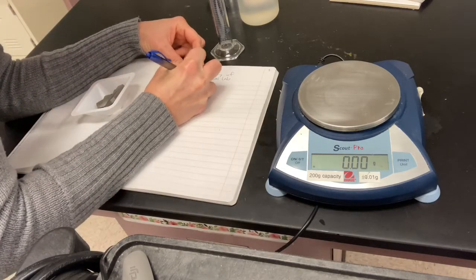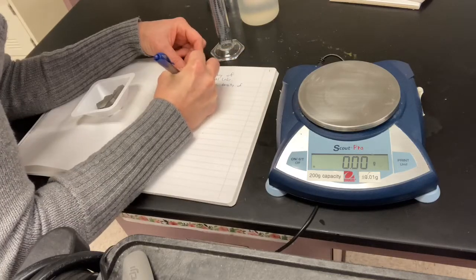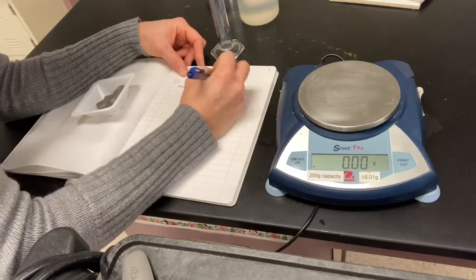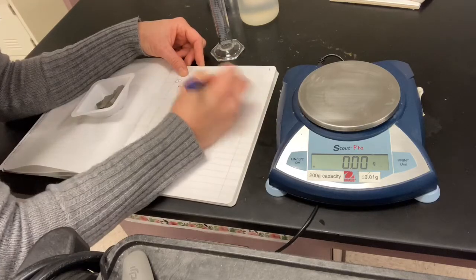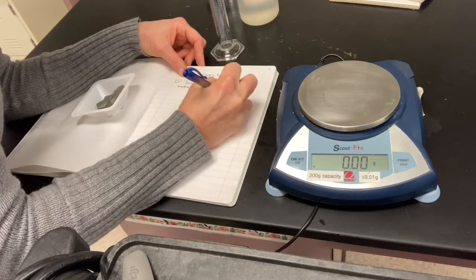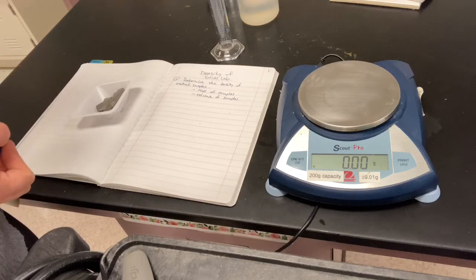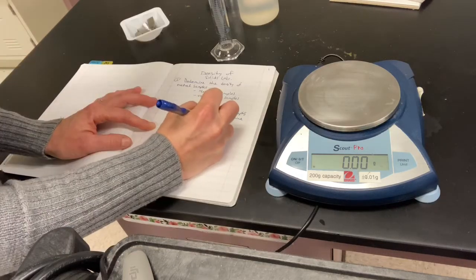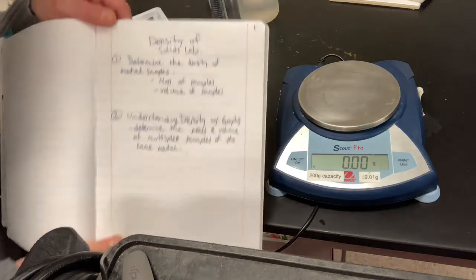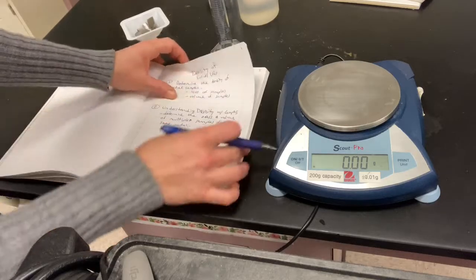So we need to gather the mass of all of our samples. In addition to that, we are going to need to measure the volume of our samples. We're going to look at specifically how we're going to deal with getting volume of these samples when we dig into our data collection. The second part of what we're going to be doing with this lab is playing with some graphs. So we're going to need to think about how do we use graphs for determining density and other things.